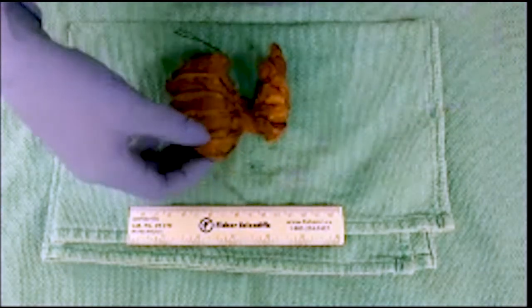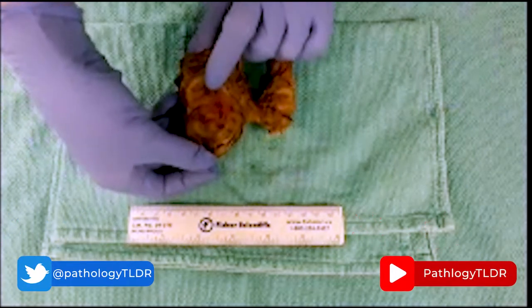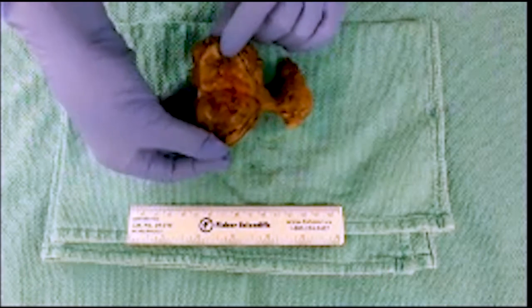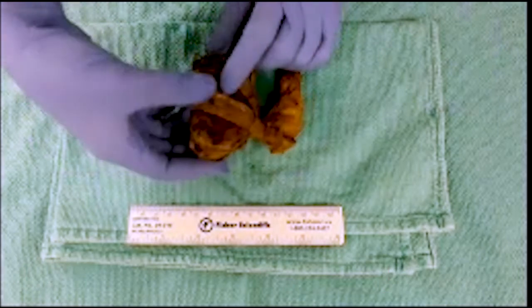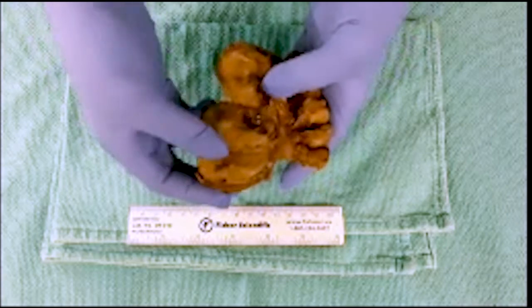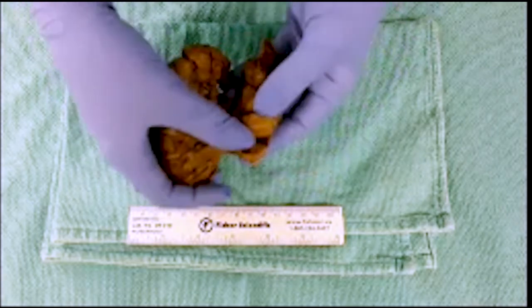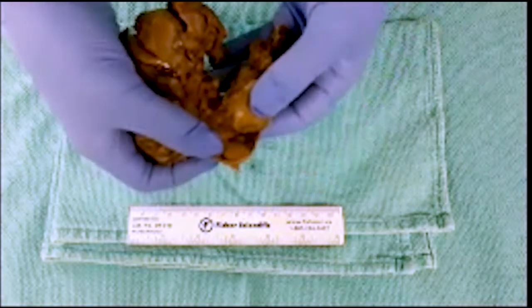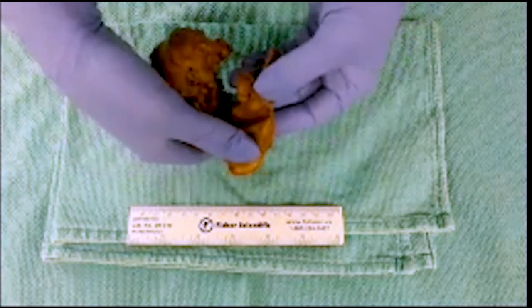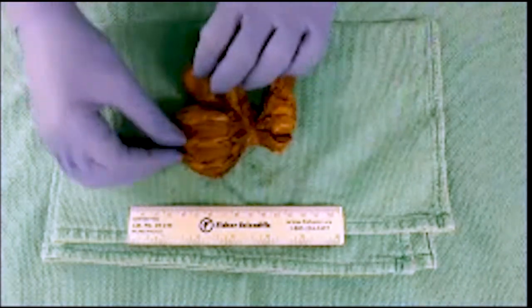At the time of opening we do make cut sections into the organ to let fixation occur, and this is what we're seeing. In the left lobe we have a large lesion occupying the majority of the parenchyma. If we move to the right lobe, you can see there is another nodule, and then we start to see some more normal parenchyma at the superior aspect.